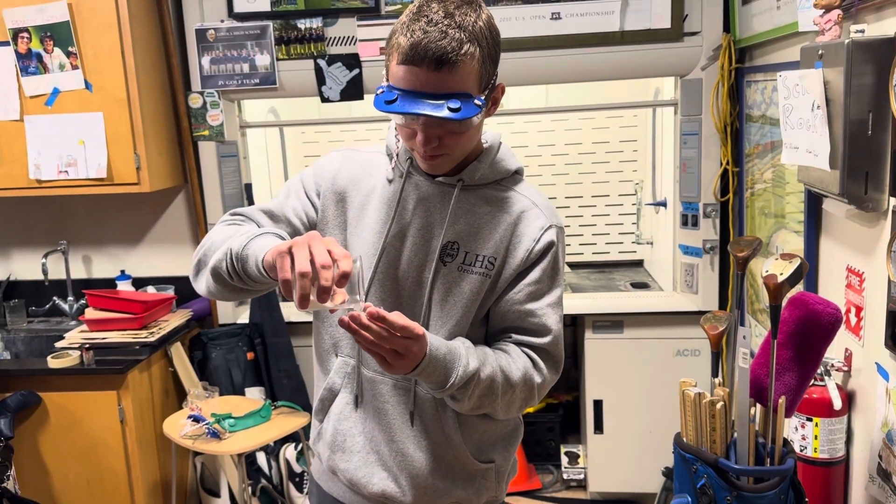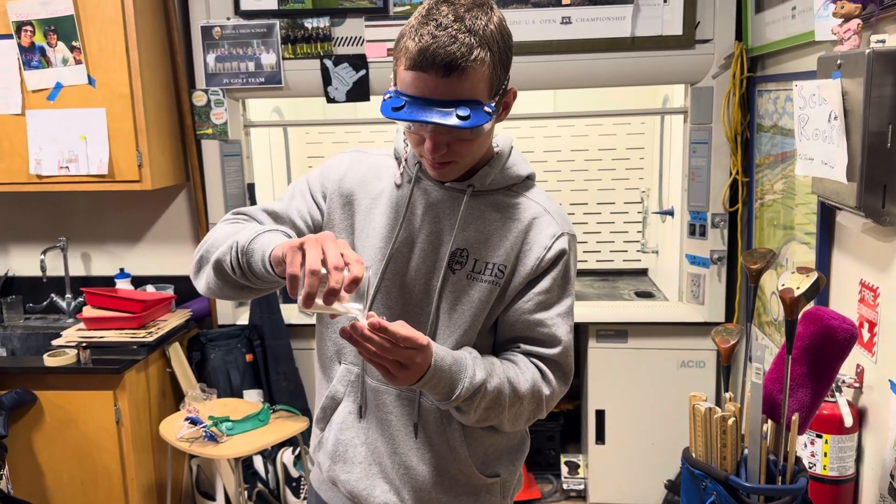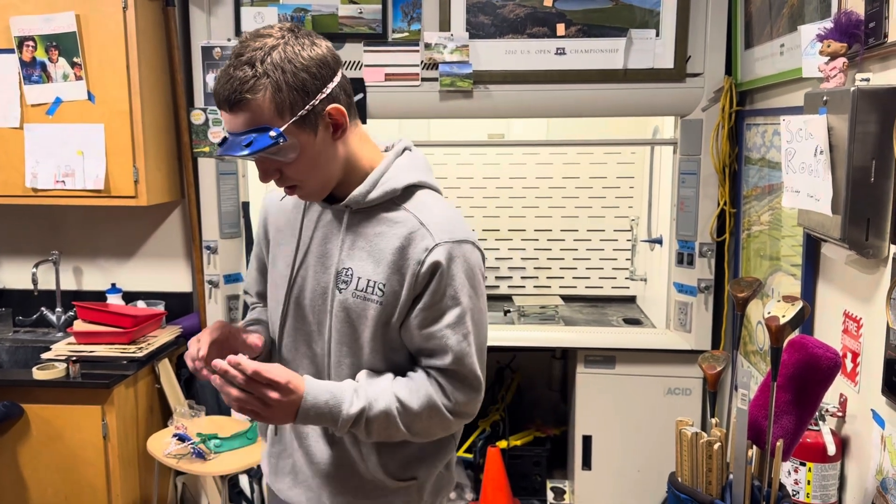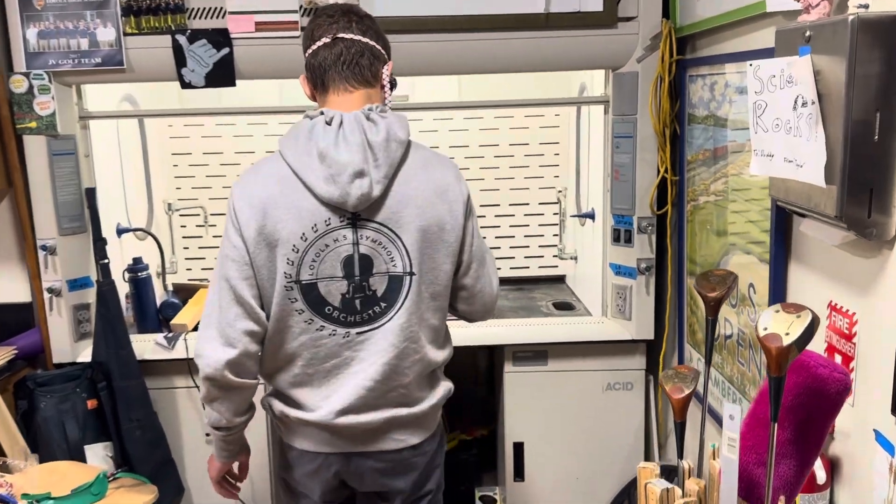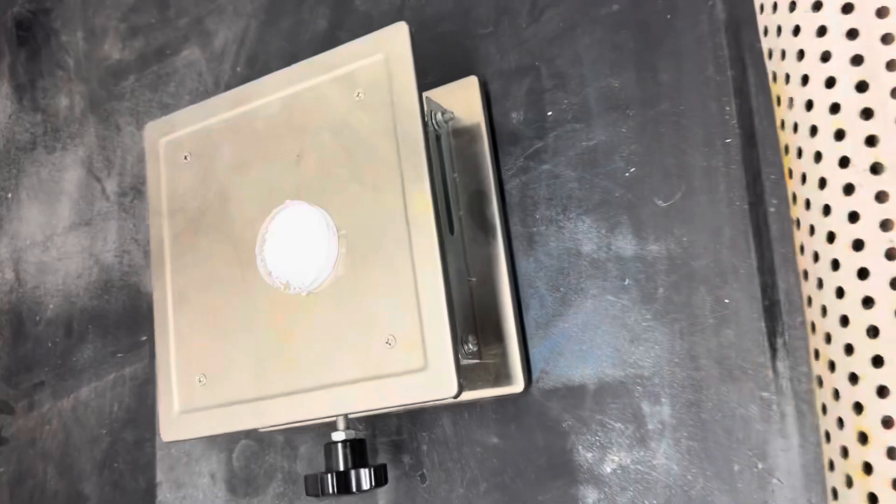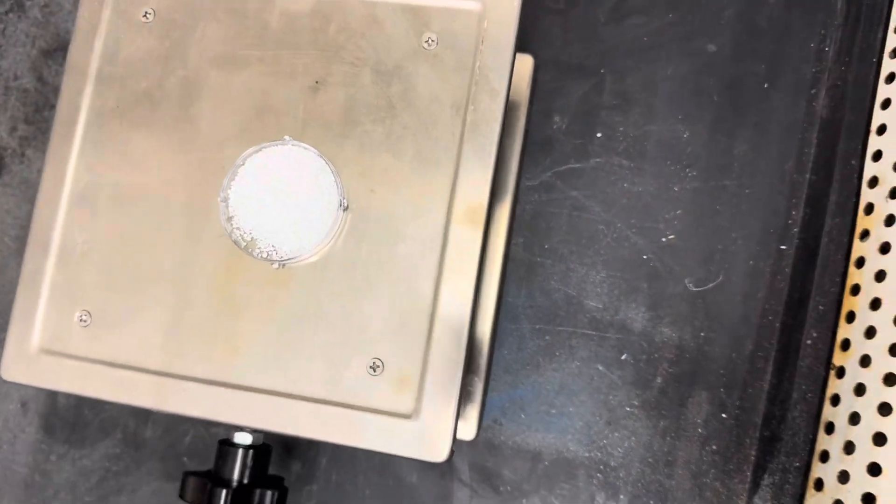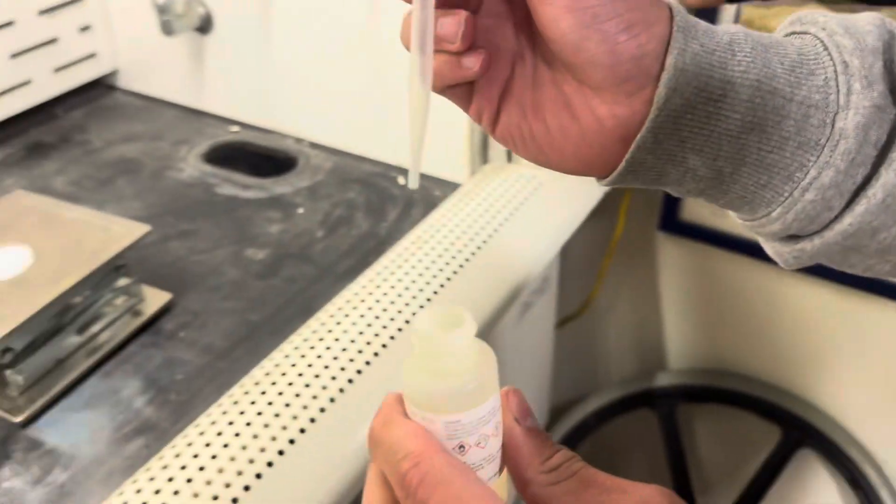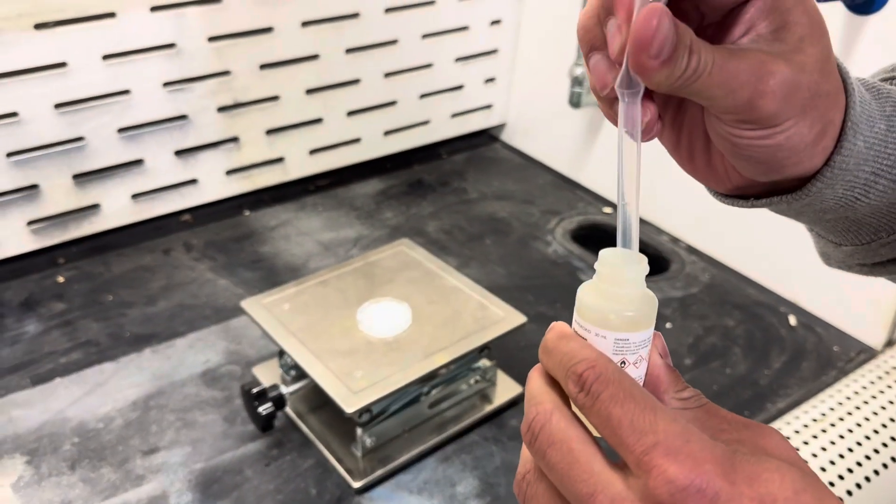So here we have the 30% hydrogen peroxide. Very beautiful. We're preparing the sodium dichlor and we're going to go ahead and place it in the hood. So once you're ready for the reaction, we'll do the first thing. Hopefully this works.